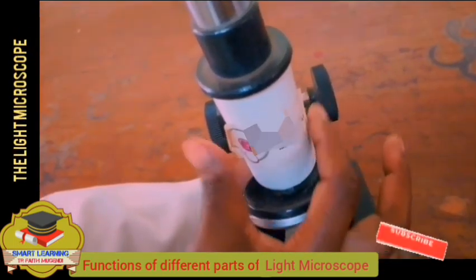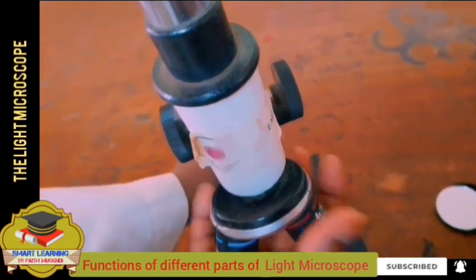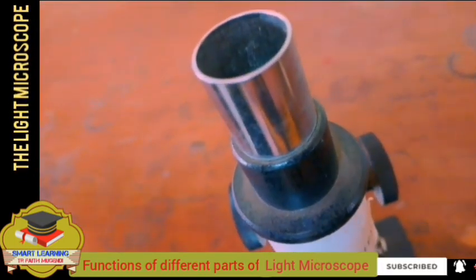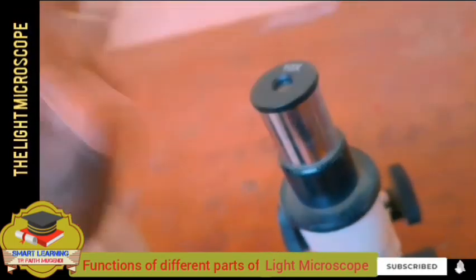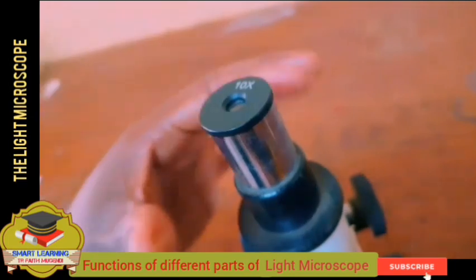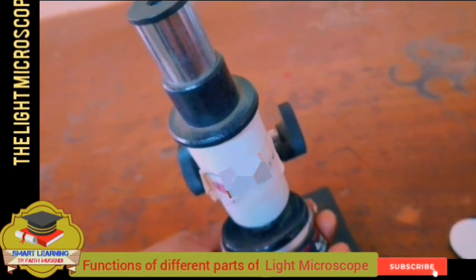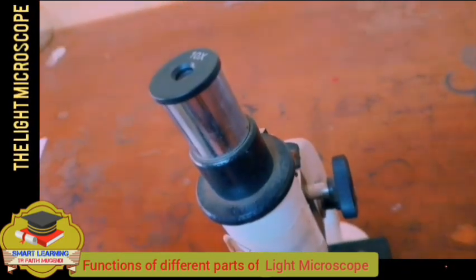Now let's look at the body tube. The body tube holds the objective and the eyepiece. So when you talk of the eyepiece, we are talking of the eyepiece lens. You can put it in and remove it. So this is what we are talking about, the eyepiece. And this is the body tube. The whole of this is the body tube, and you can see it is holding the objective and the eyepiece.